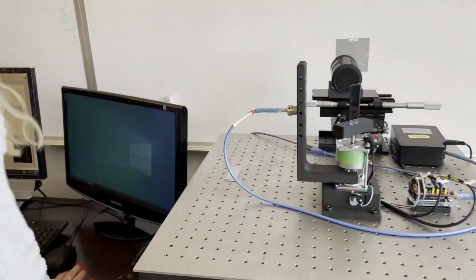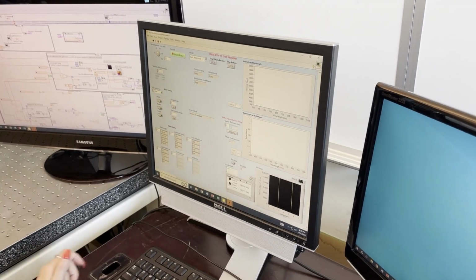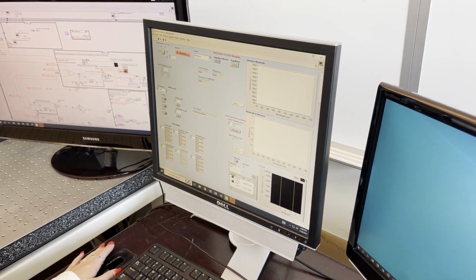Now you're going to take your dark reference measurement. So hit record again. You're going to want to see a flat line at the bottom. Once you're satisfied with that, stop recording and change the mode. This time you're going to want to do the reflection mode.